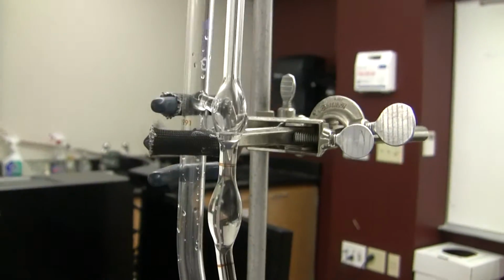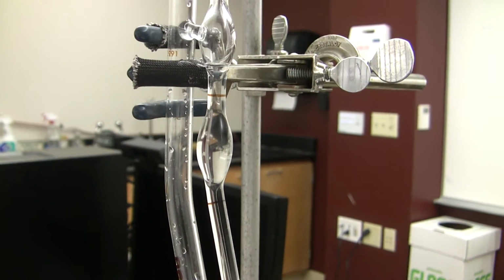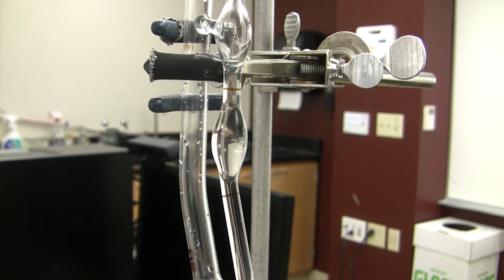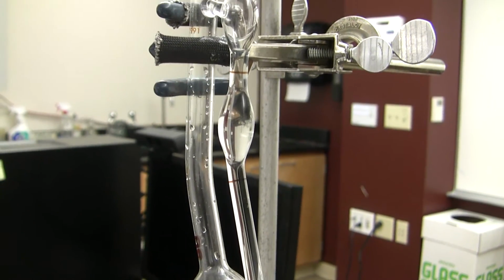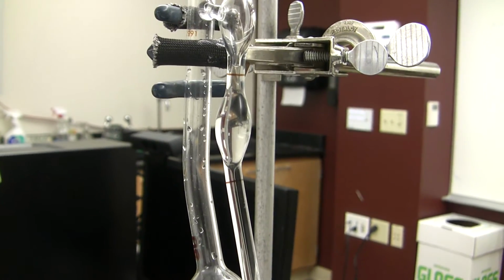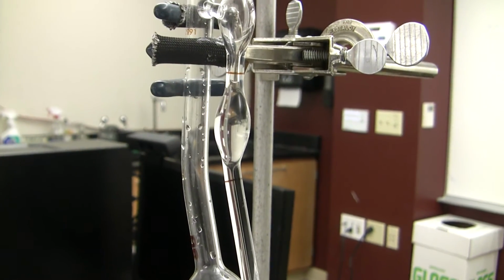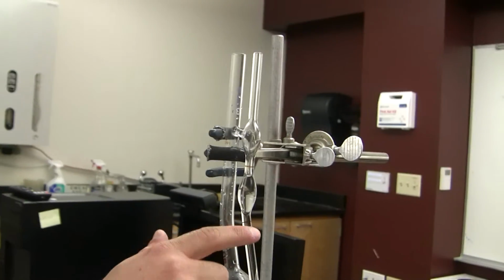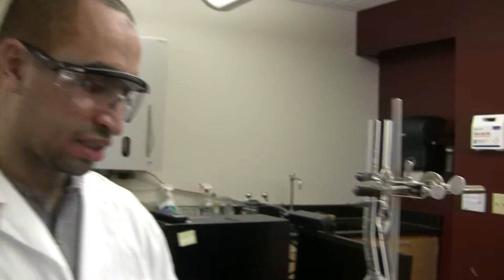So now, once the water starts going down below this, we start recording the time. So start recording now, and then we let the surface of the water go down until it reaches the second mark, and that's it for this experiment.